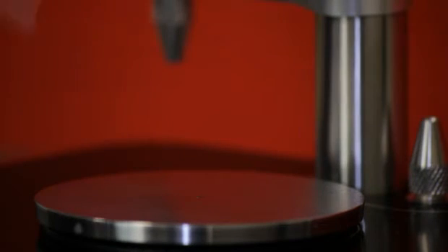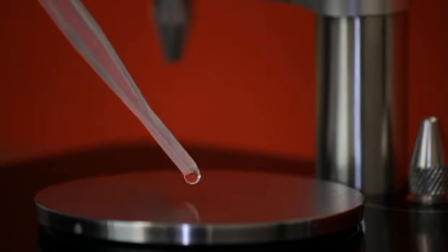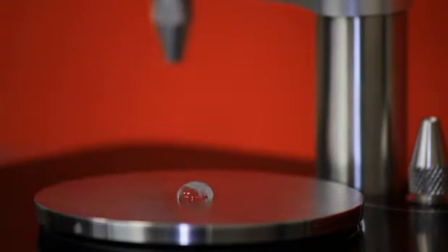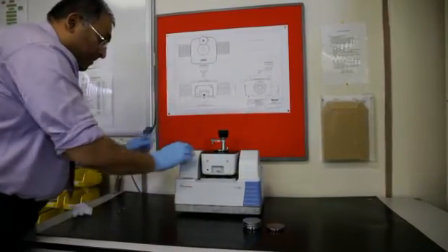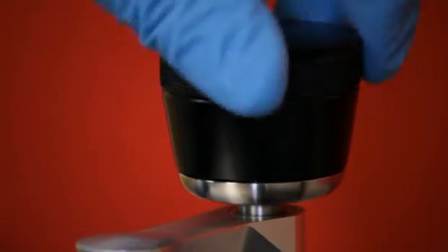The rotating arm assembly can be moved away to allow easy access to the crystal puck. Liquid samples are simply spotted onto the crystal. For solid samples, the arm assembly is turned to its sampling position and the torque screw knob turned to lower the anvil.